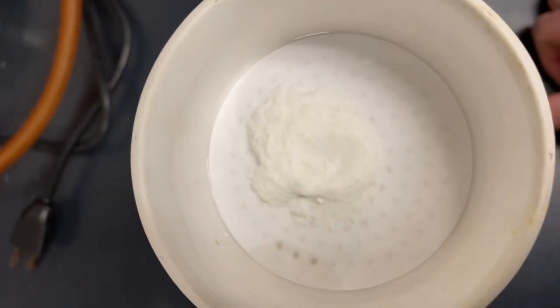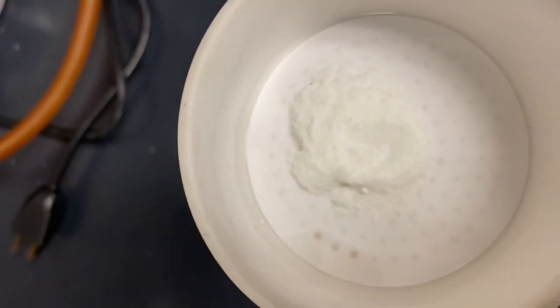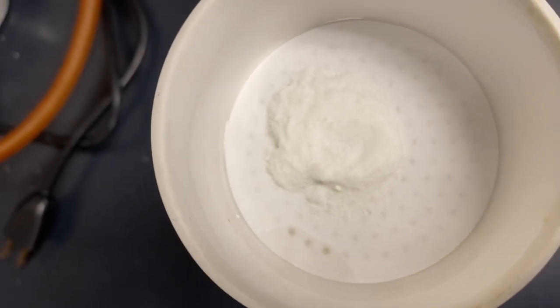So now we've filtered it through the Buchner funnel, and we're going to let this sit on here for a little bit to try to pull off any of the residual solvent.